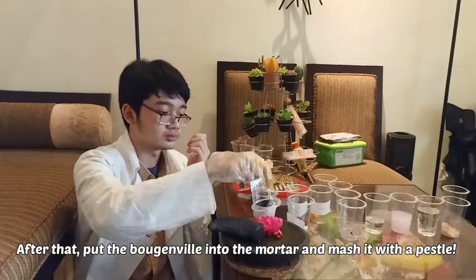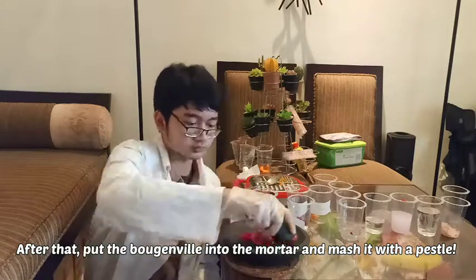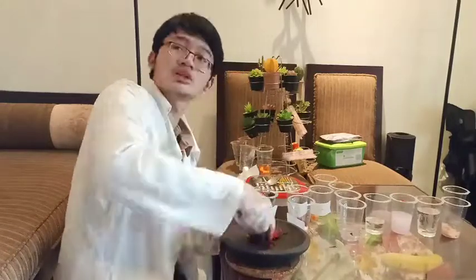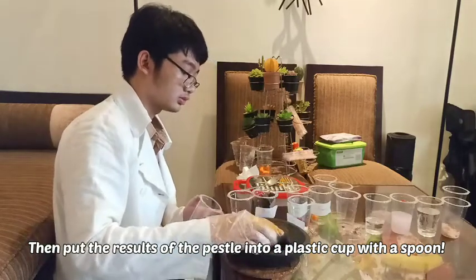After that, put the bougainvillea into the mortar and mash it with a pestle. Then put the result of the pestle into a plastic cup with a spoon.